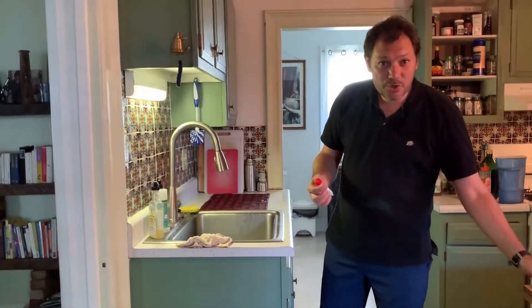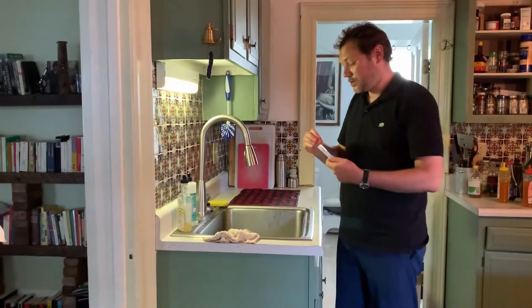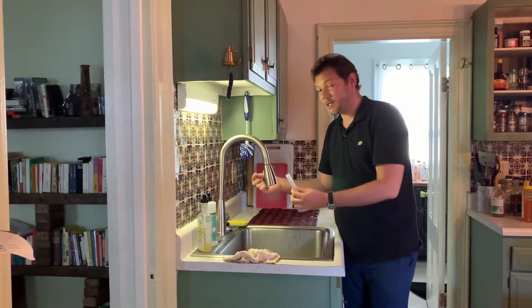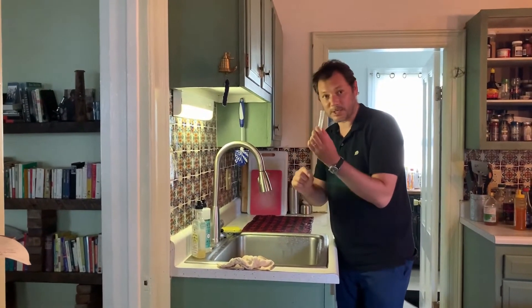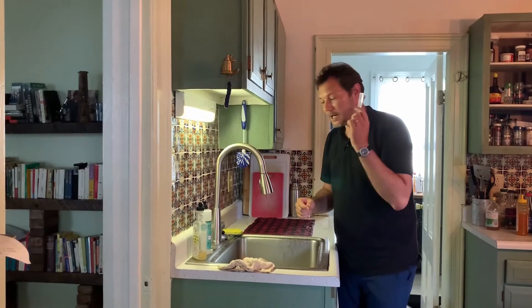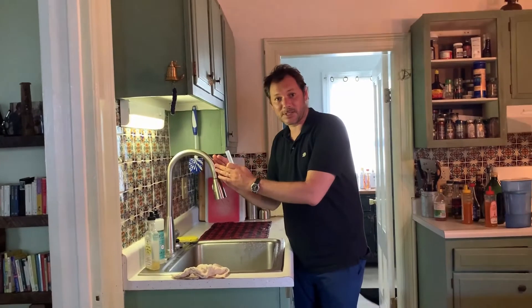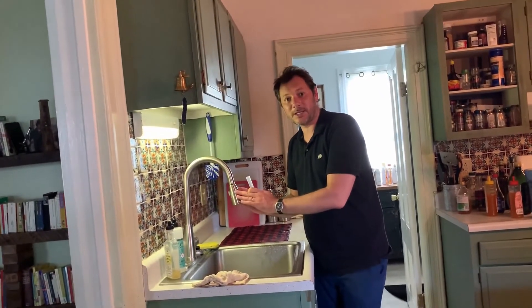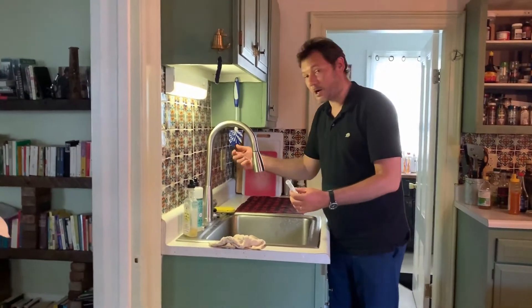Imagine it is early in the morning and nobody has used the water yet. You're going to do your first flush: take your tube, open it, and sample the first 15 milliliters that come out — that's the volume of this tube. Also make sure you select a tap that doesn't have a filtering system, and do not remove the aerator or anything on the tap; just use it as it is, as if you were taking drinking water normally.